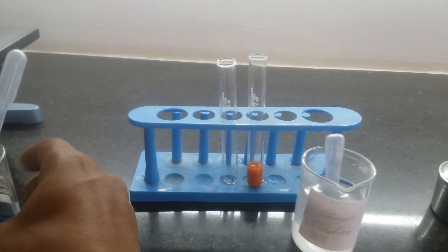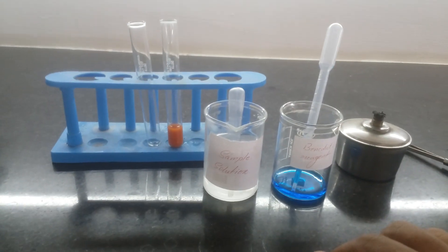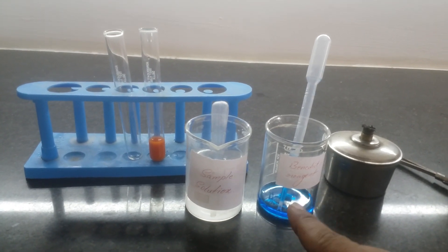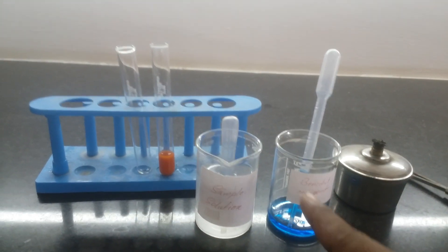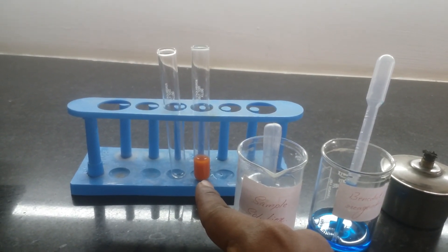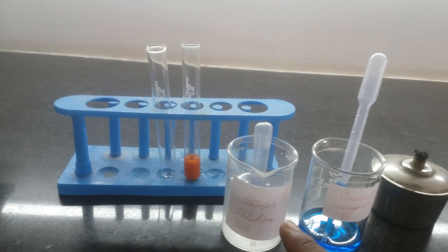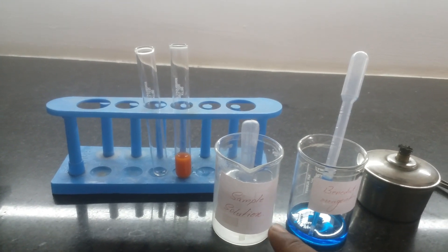The principle behind this color change is that glucose contains a free aldehyde group. That free aldehyde group reduces the copper sulfate present in Benedict's reagent into cuprous oxide. Cuprous oxide is brick red in color, so the formation of this brick red color indicates the presence of glucose in the given sample solution.